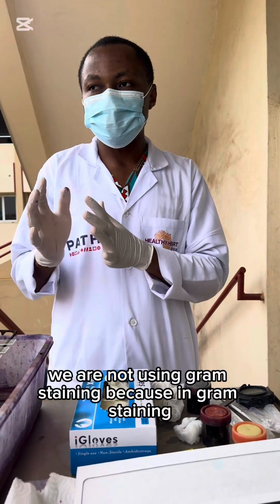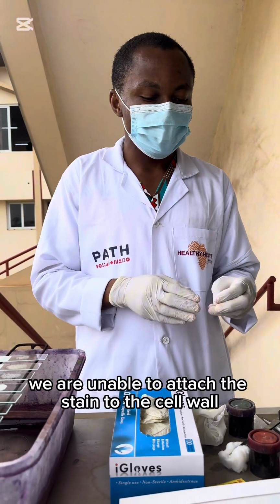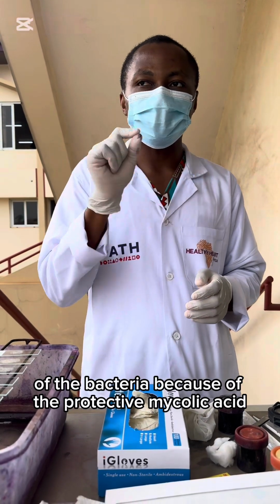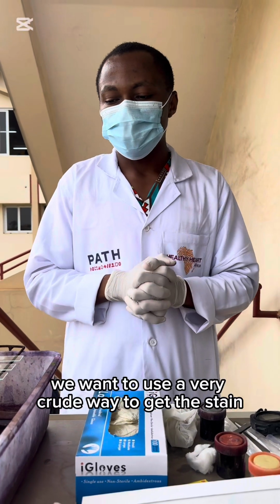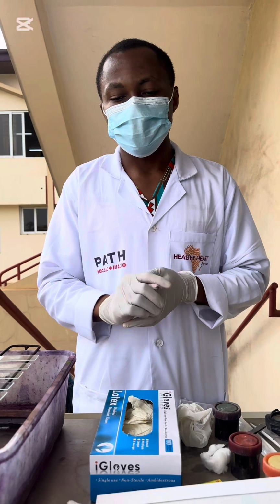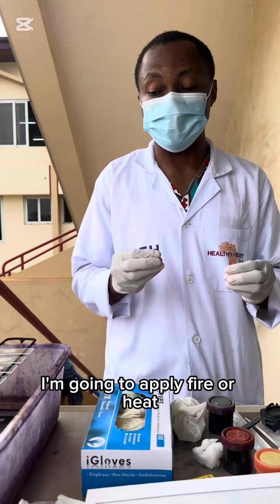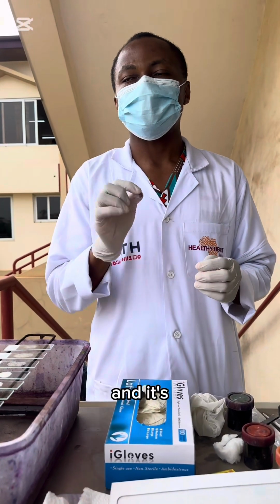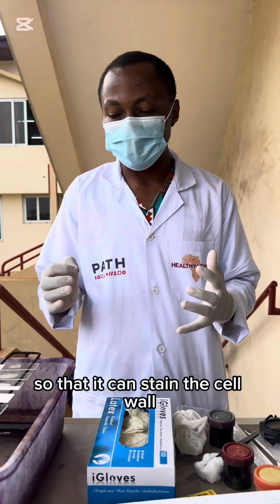We are not using Gram stain because in Gram staining we are unable to attach the stain to the cell wall of the bacteria because of the protective mycolic acid it has in its cell wall. So we want to use a very crude way to get the stain to the cell wall of the bacteria. So we are using the carbol fuchsin. In this staining technique, I'm going to apply fire or heat to ensure that the mycolic acid is broken down and it gives way for the carbol fuchsin to penetrate so that it can stain the cell wall.